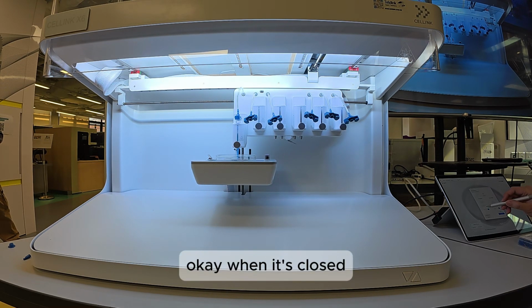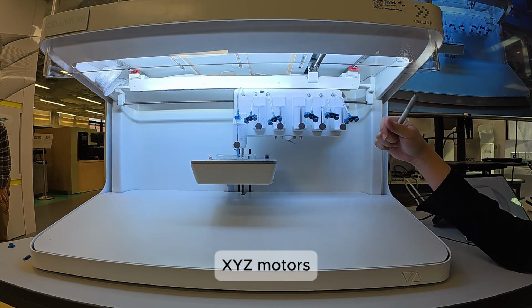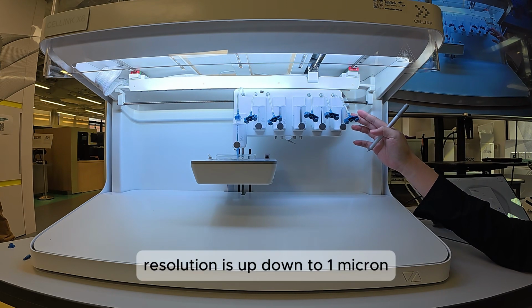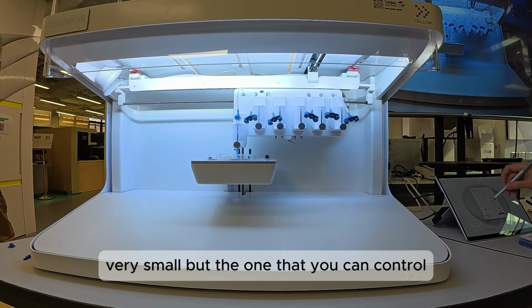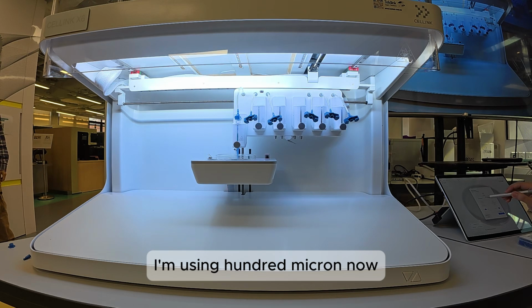Okay, when it's close, change to the smaller step size. These motors here, XYZ motors, the resolution is down to 1 micron. Very small. But the step size that you can control is 10 micron. I'm using 100 micron now.